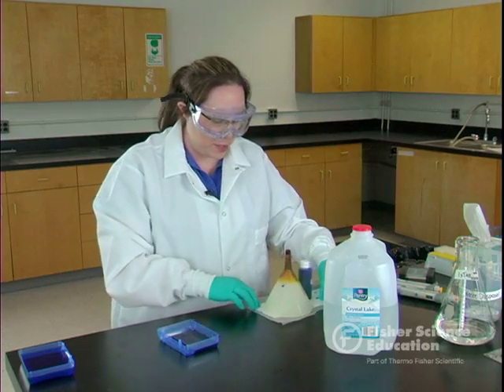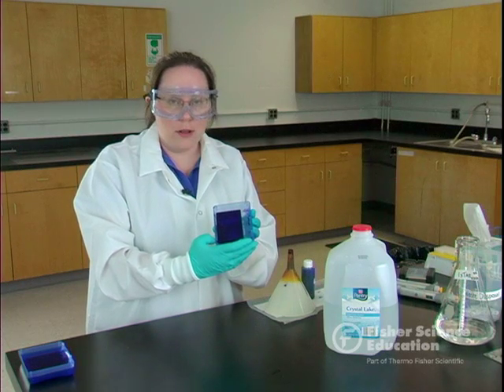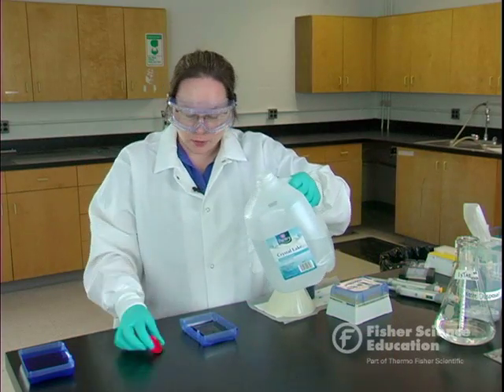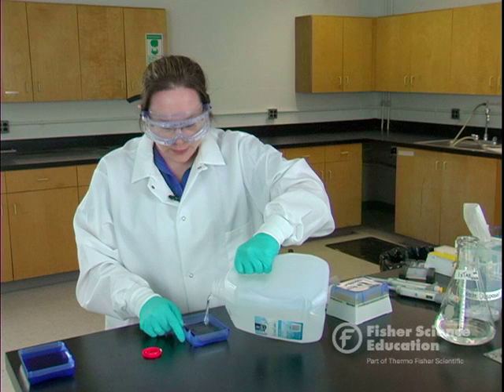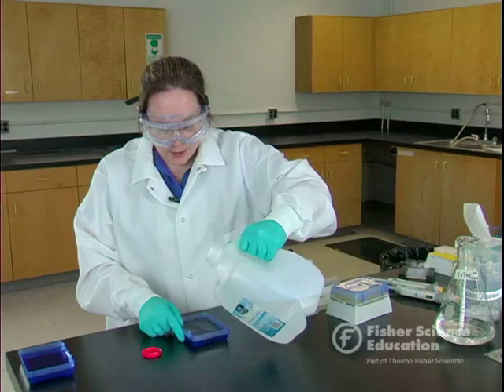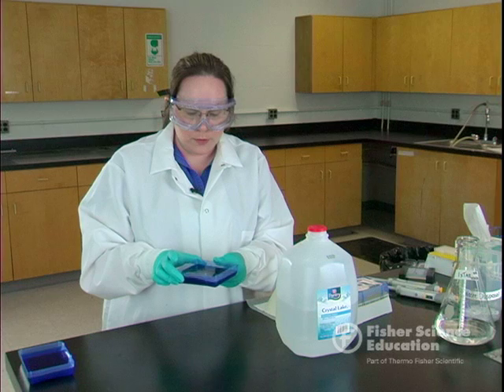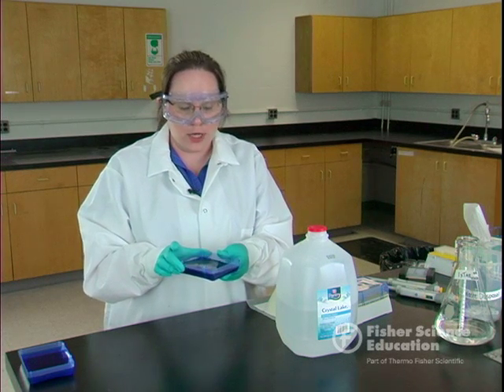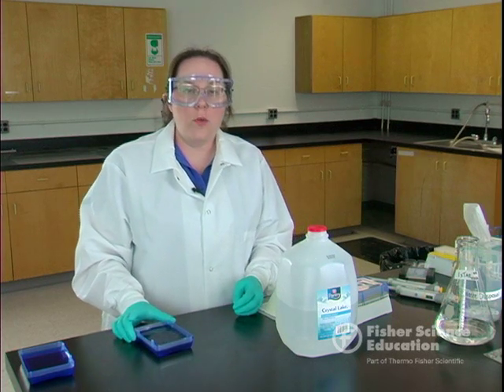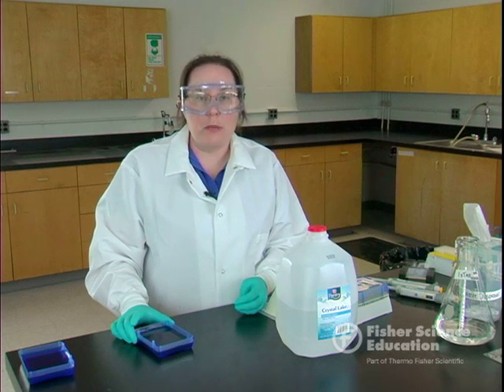Make sure to recap the bottle in case it gets knocked over. The gel is very darkly stained — we need to de-stain it. The gel has absorbed the stain in these five minutes. The easiest way to de-stain is to add distilled water, making sure it completely covers the gel. If your lab has a shaker, have it gently shaking and don't overfill. If you don't have a shaker, agitate it every once in a while. Don't change out the water more than three times. This can sit overnight or be done in as little as 20 to 30 minutes depending on your schedule.